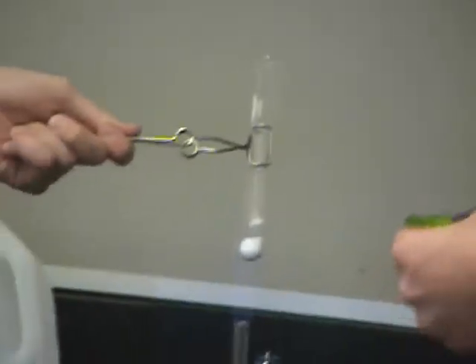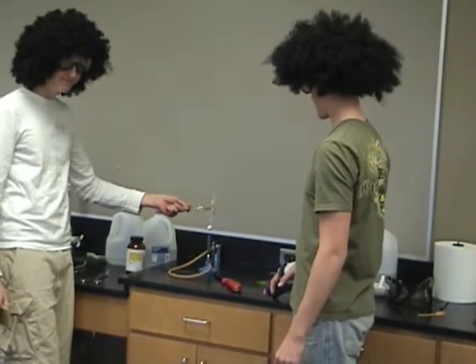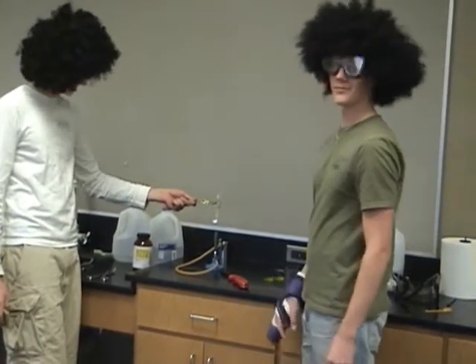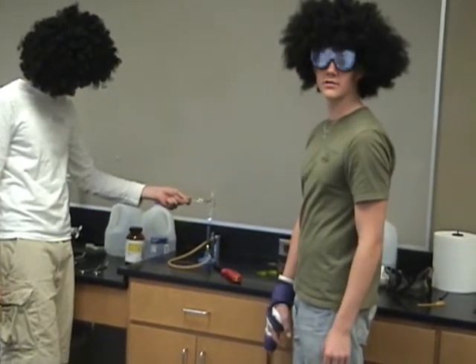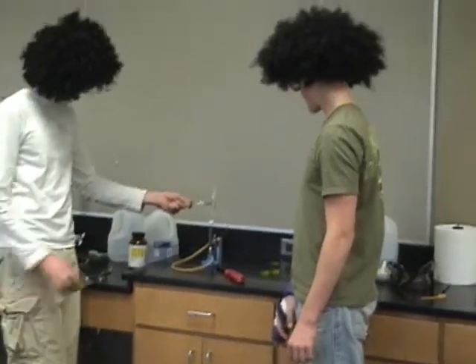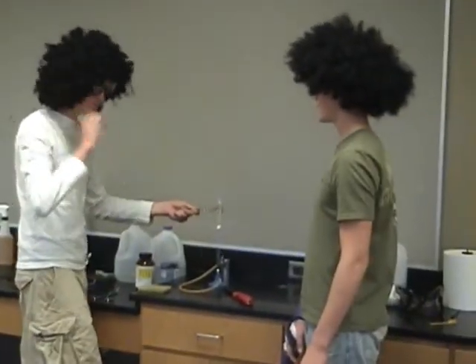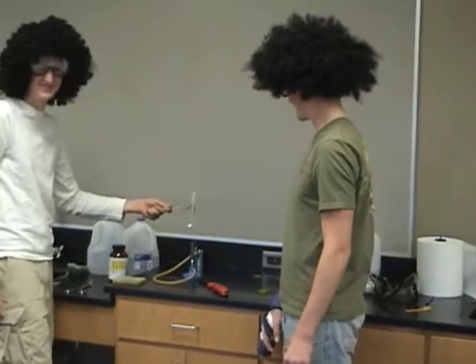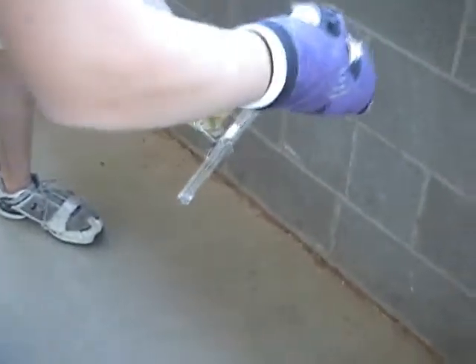Wait — this is good to have a wet sponge so you do not burn your hand. You must wait a little bit. Patience is a virtue, or something. Now what we are going to do is drop the gummy worm in, and it shall make a reaction.